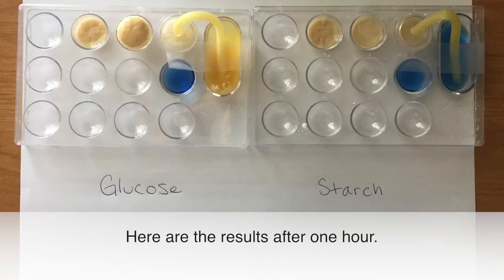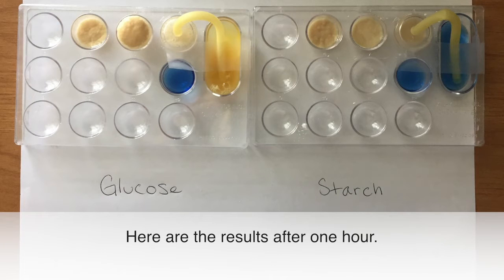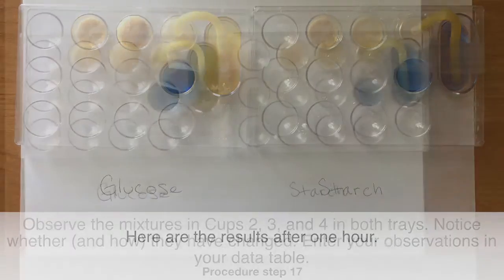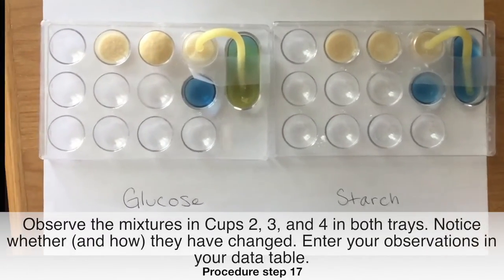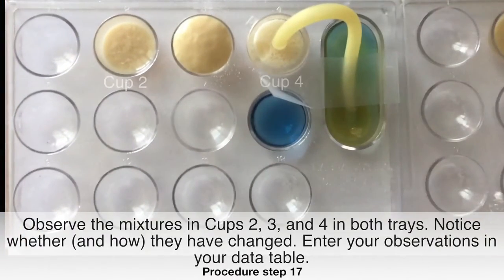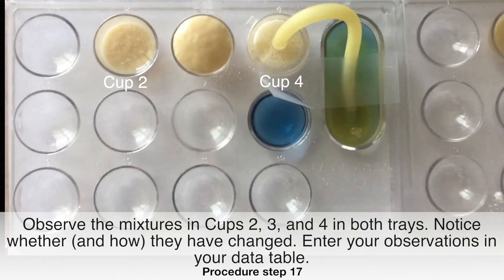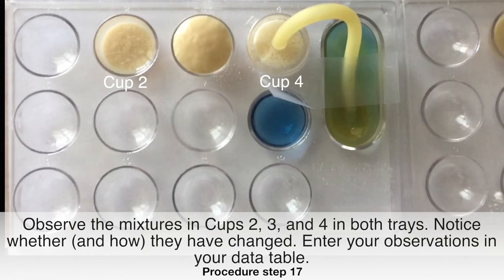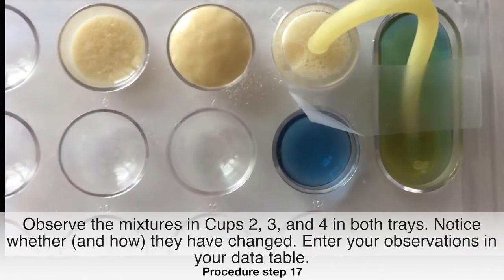Here are the results after one hour. Observe the mixtures in cups 2, 3, and 4 in both trays. Notice whether and how they have changed. Enter your observations in your data table.